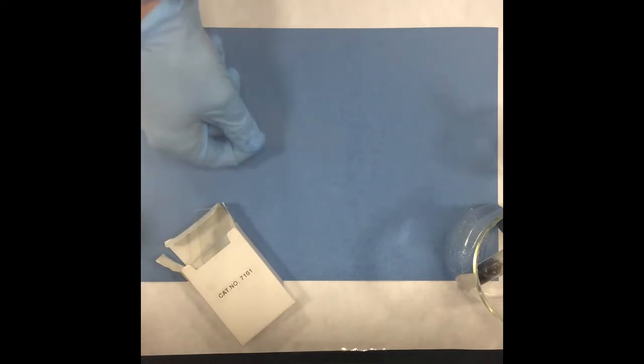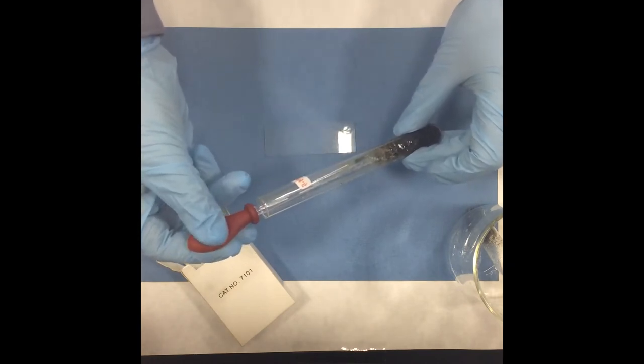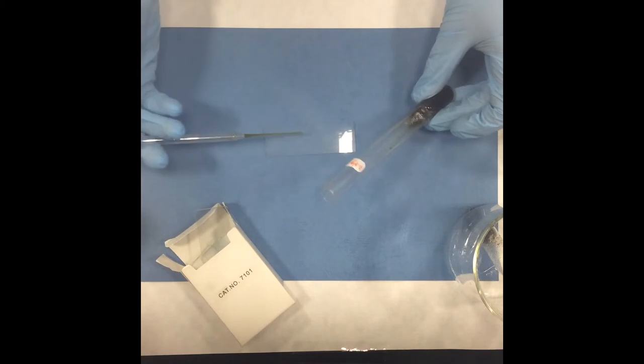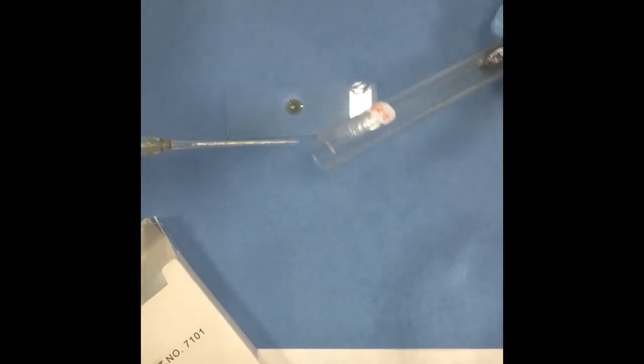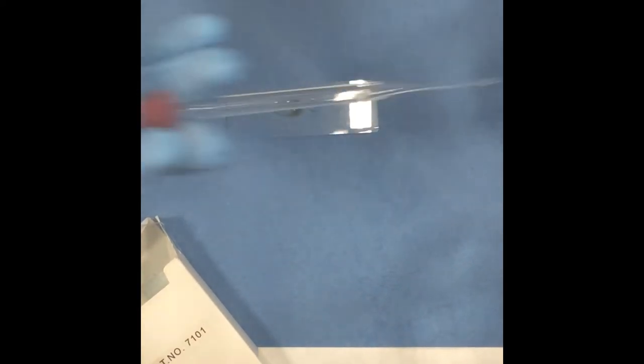Using a glass slide, place it on a flat surface. From your sample, place a few drops to the center of your glass slide. Using a clean pipette, add a small amount of glycerol onto your sample. Make sure the glycerol and your sample are well mixed.